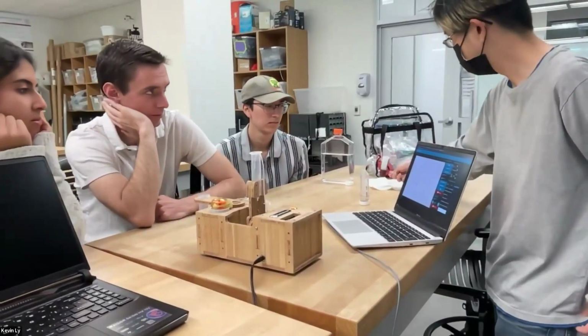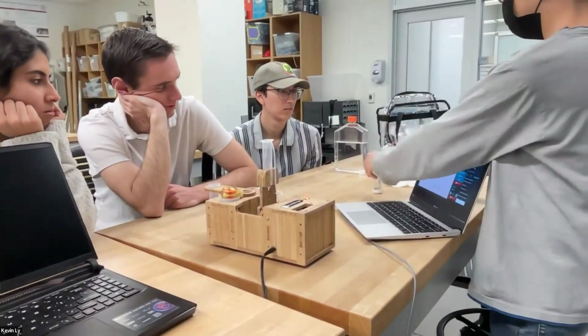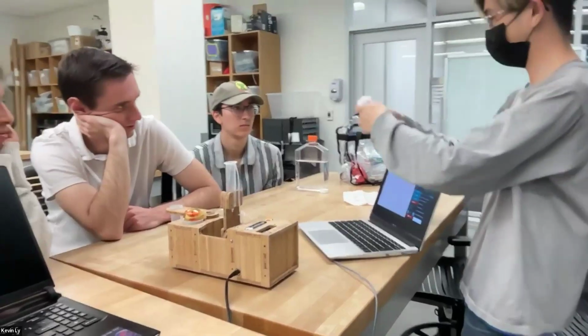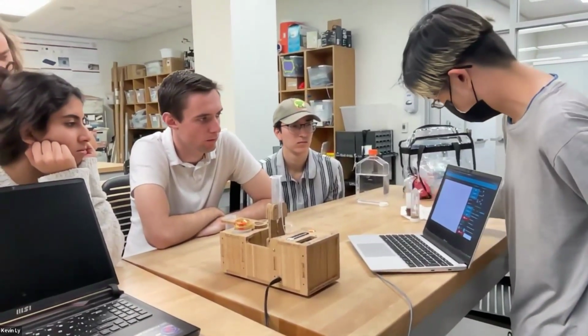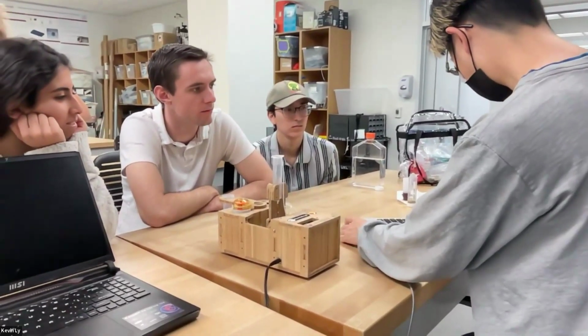Would the pond scum clog it up again? Yeah, so I think most of the pond scum either sunk to the bottom of the bottle before I was able to pour it in, or it got trapped by the filter. Oh yeah, that's something. Let me slow down the flow rate a bit.